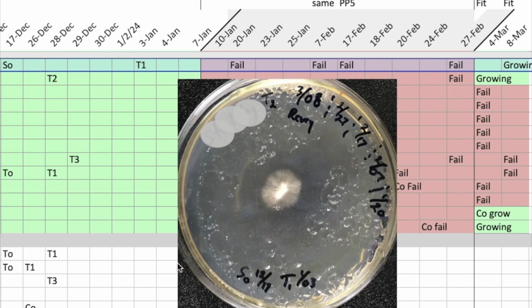Just following one variety through the troubleshooting, it was swabbed in December and grew out, and a transfer was made, and that was growing successfully. And then I got into the 80 plates of agar that weren't good in January, and on the 20th this was moved on to that bad agar batch and didn't grow, so I moved the transfer square to another plate on February 7th, and that one still didn't grow.